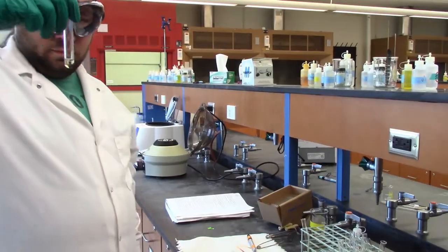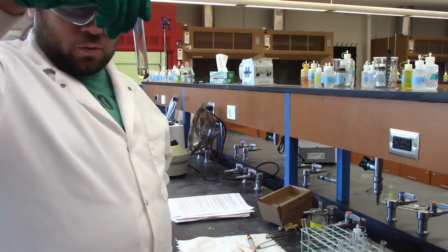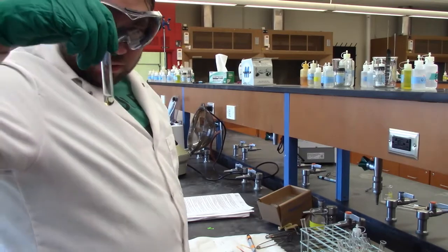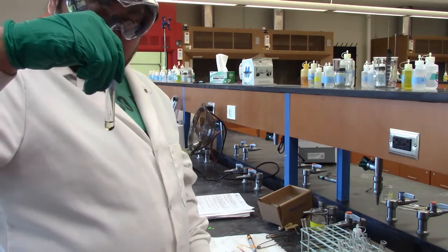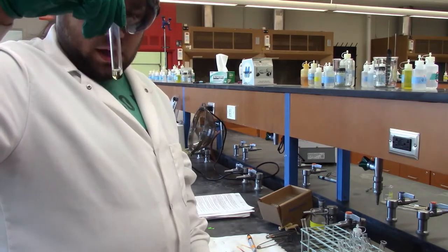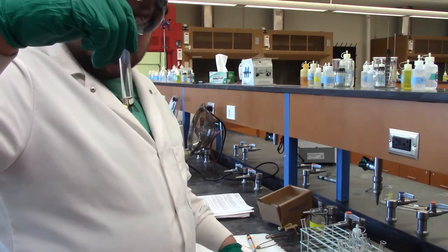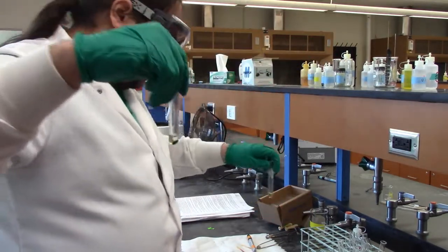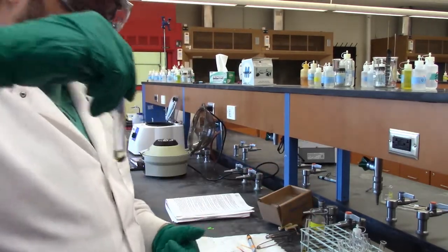Good. So, just so you guys can see, that was the first wash. As you can see, there's still kind of a tint of yellow to the solution. I buttoned up my lab coat so that it doesn't go in front of my shirt anymore. So I still got the tint of yellow, which means there's a little bit of the tin solution in there. However, we have plenty of the tin over here, so I'm just going to throw that out. We don't need that little bit. And we're going to do a couple more washes, and we'll come back to this in a little bit.